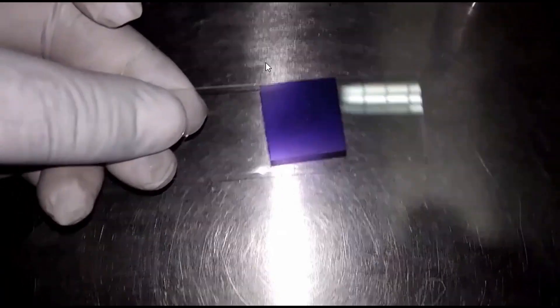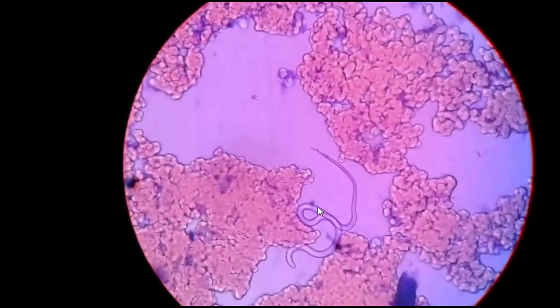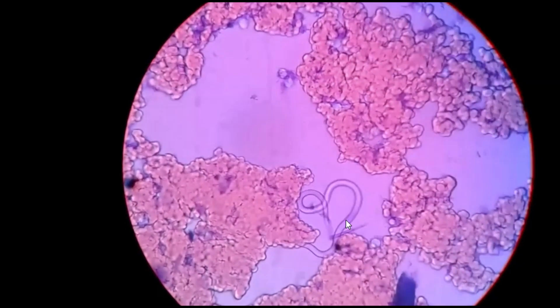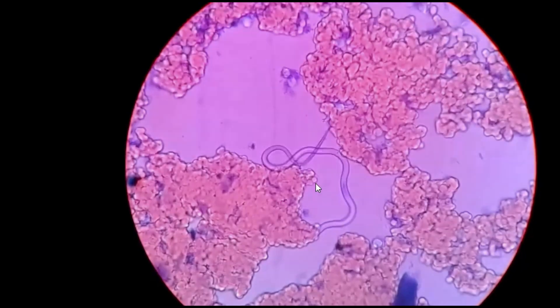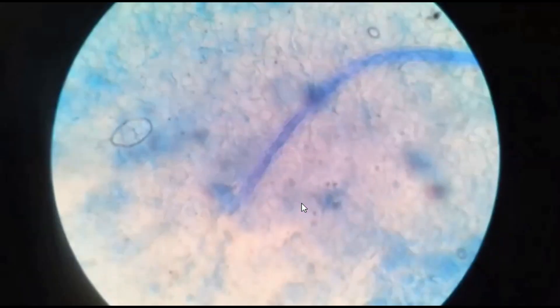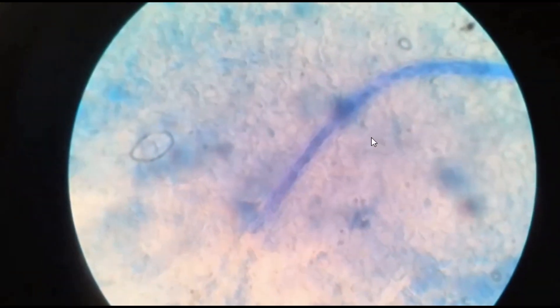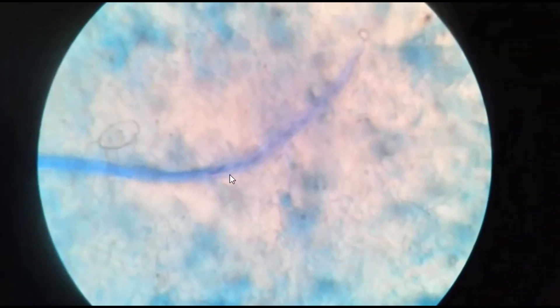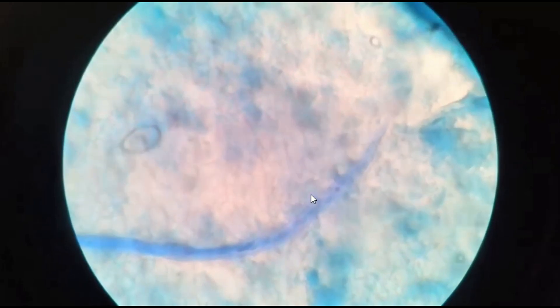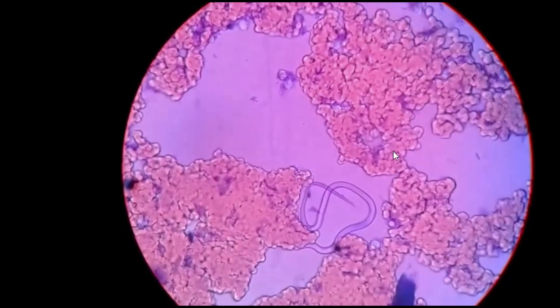Let's go with this slide. Oh my god, here you can see this is the live microfilaria — isn't it? You can see the movement. And this one is dead microfilaria. We are observing at 100x objective, that is oil immersion field. I hope this video will be helpful.